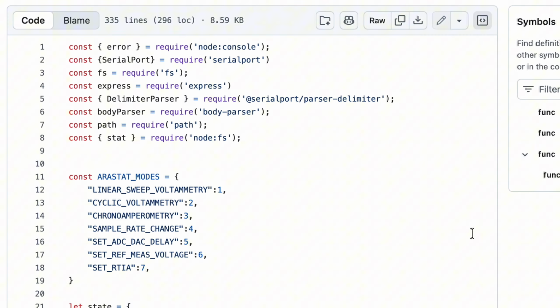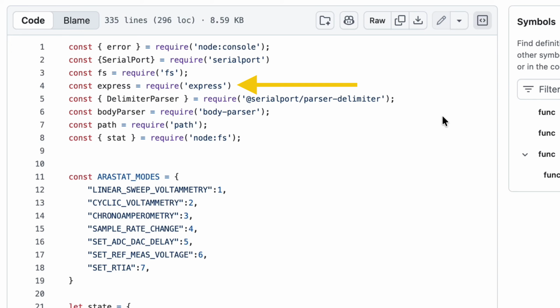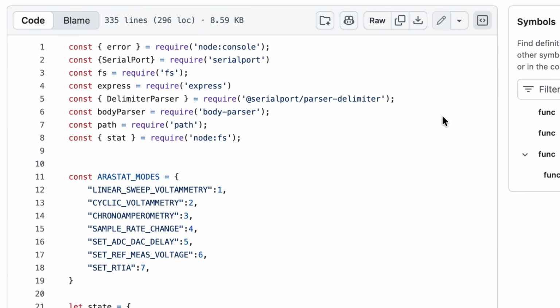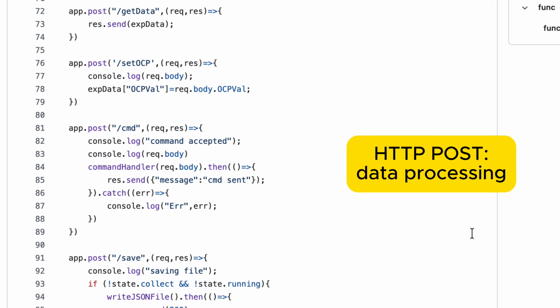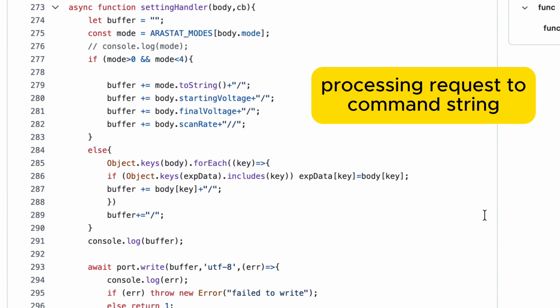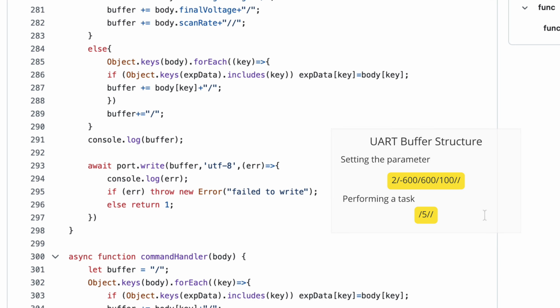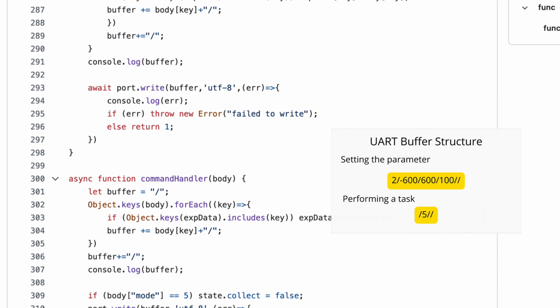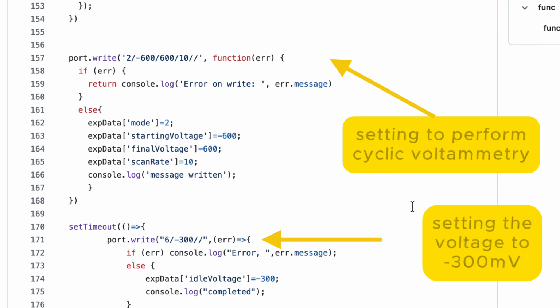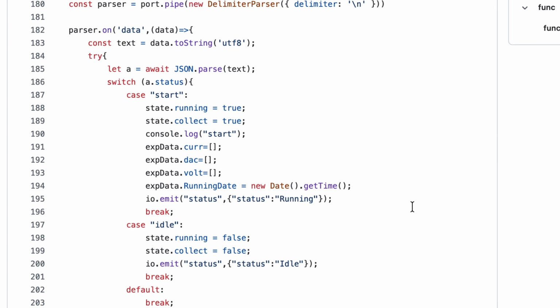At first, the web app codebase is simple and lean. We only used several libraries such as Express for routing, Socket for communication with the front end, and Serial Port for communication with the device. Our routing app is simply displaying the HTML and processing requests from the web page. One of the handlers handles the request from the web app and translates the HTTP post request data to a string of UART data our device understands. The Serial Port library is used to communicate with the device, like sending a command or handling the data from the device.